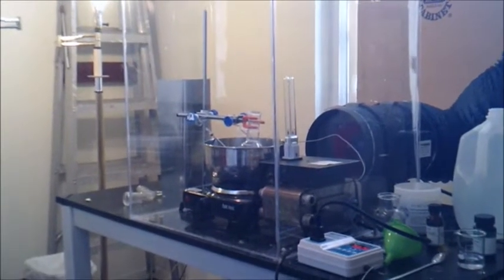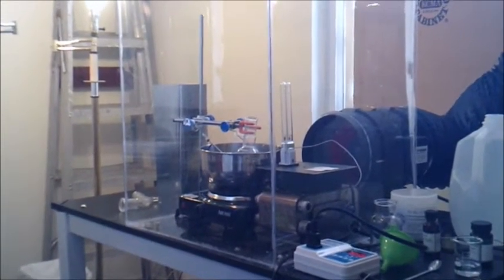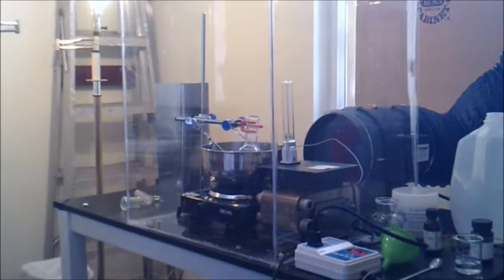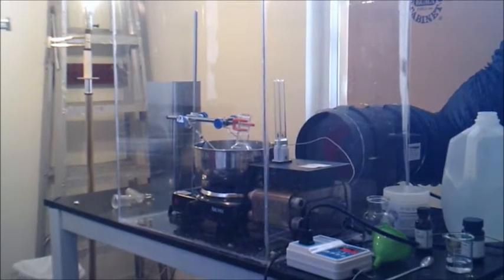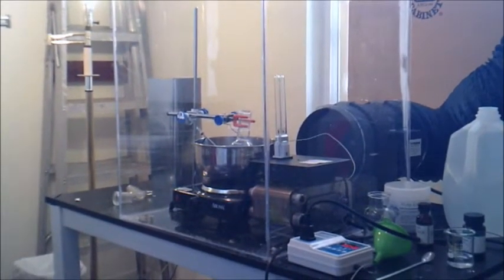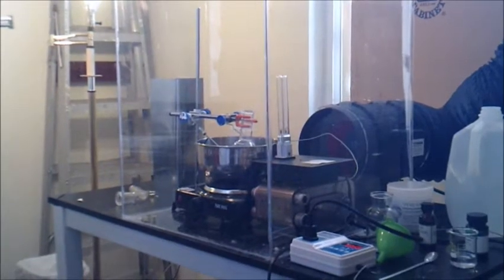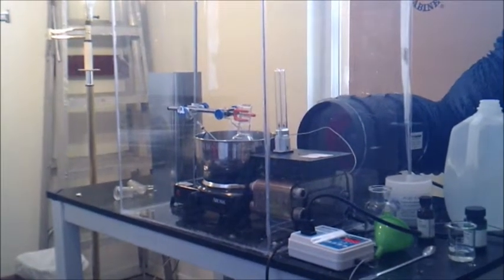Okay, as you can see here this is the chemical glove box which I made using sheets of polycarbonate. And actually it's not really a glove box because there are no ports for the gloves. However, I didn't think that was necessary.